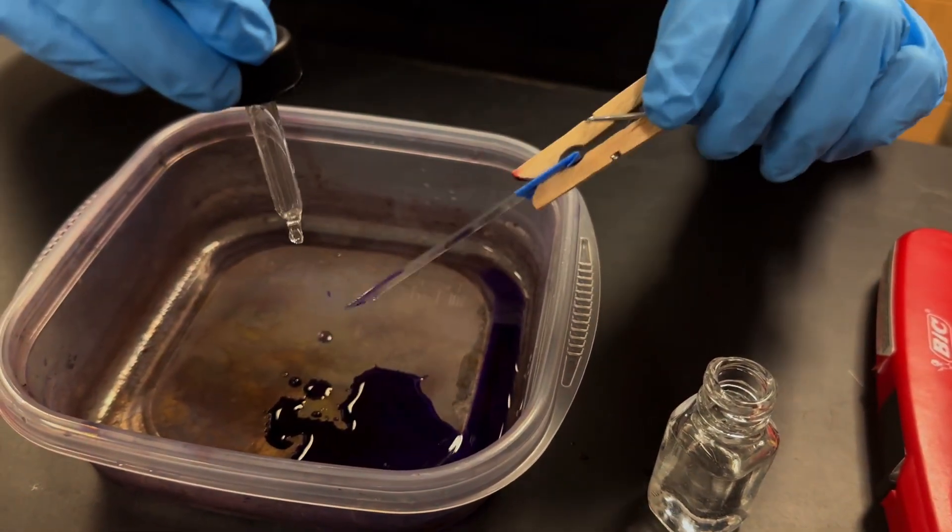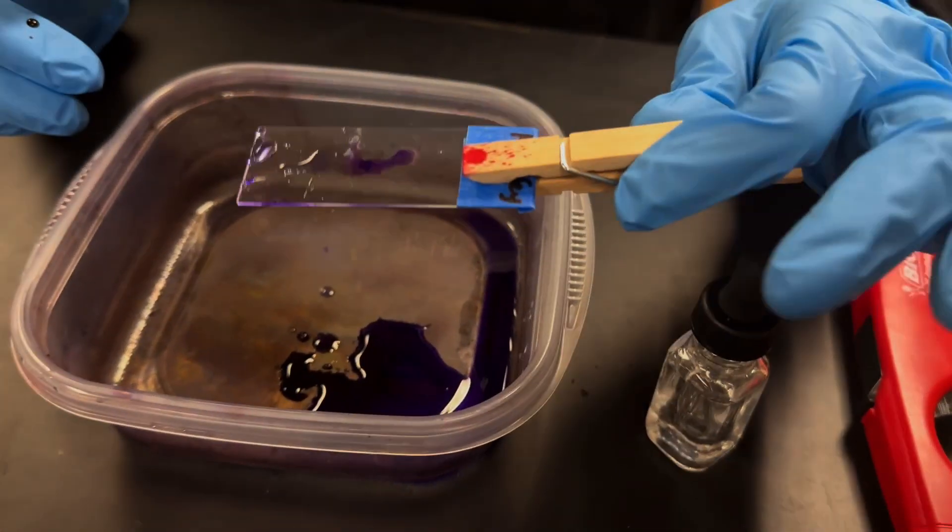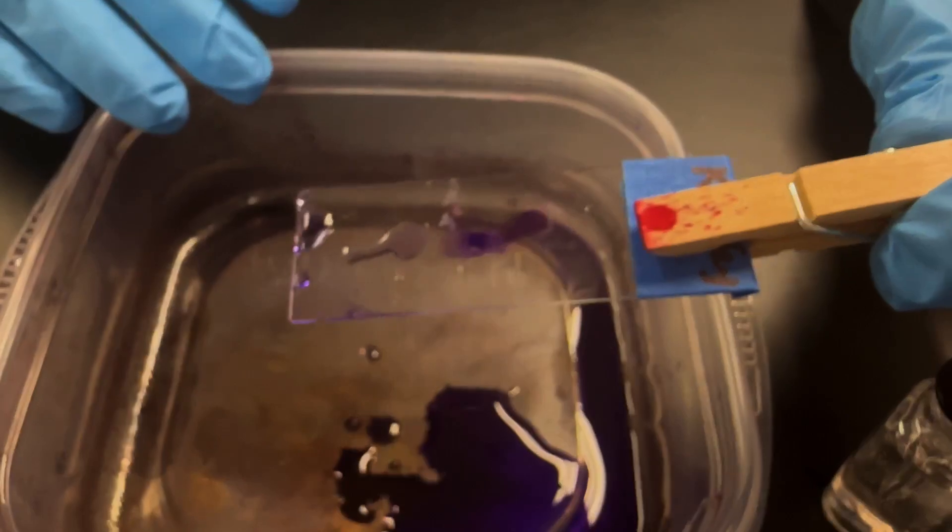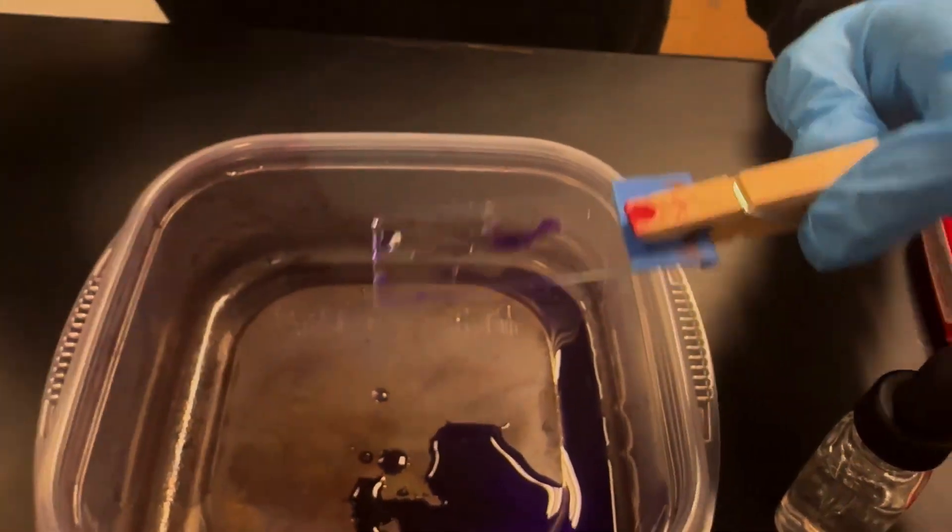You can refill your water as necessary at the sink. I think we're good. And then the instructions say do not dry or wipe down the slide. So we're finished with the crystal violet step and we're ready to move on to the next step.